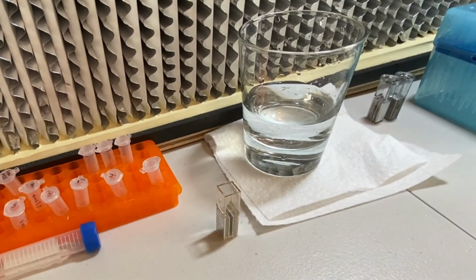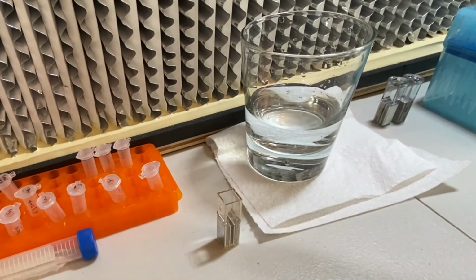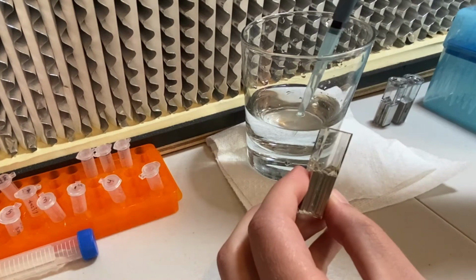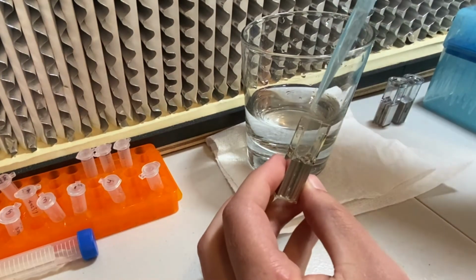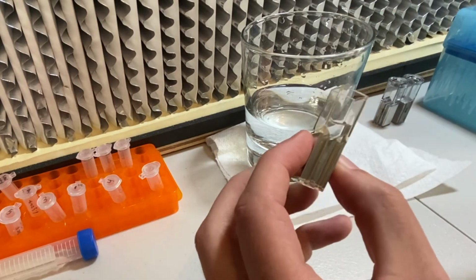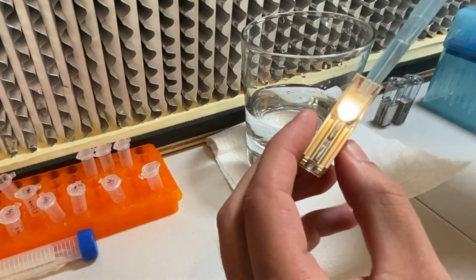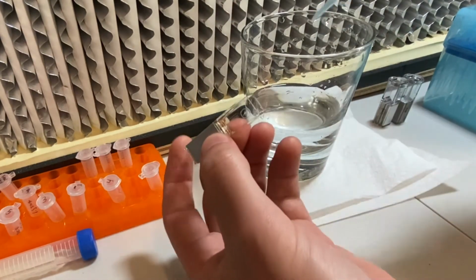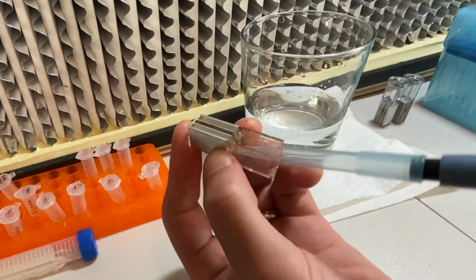So let's do a complete practice run here. Okay, beep, it zaps. We take the cuvette, take a milliliter of LB broth, pipette that in there. Great, now we take it and we're going to put it in a tube. And we're going to turn it to the side.